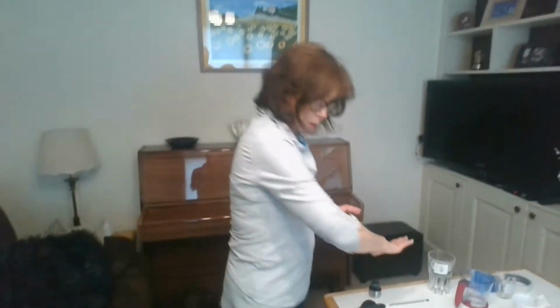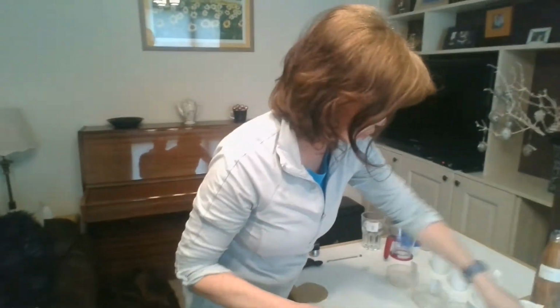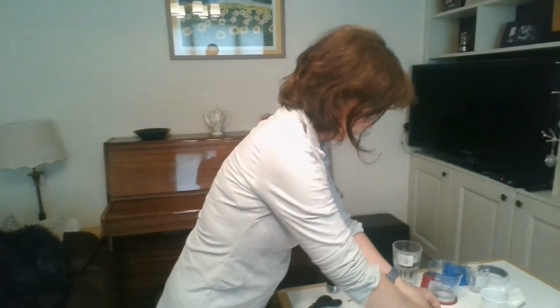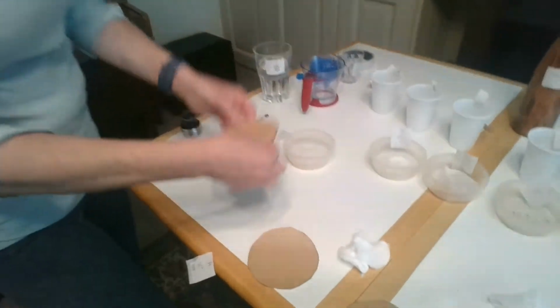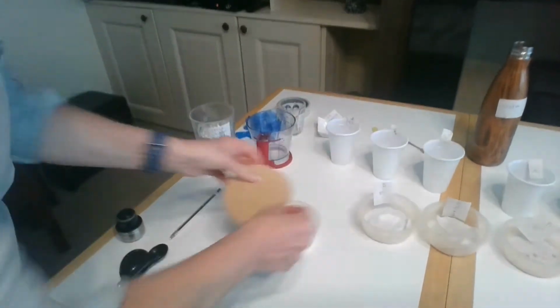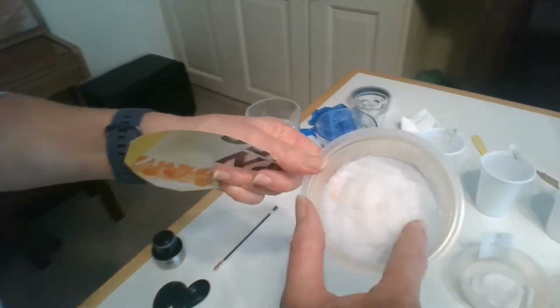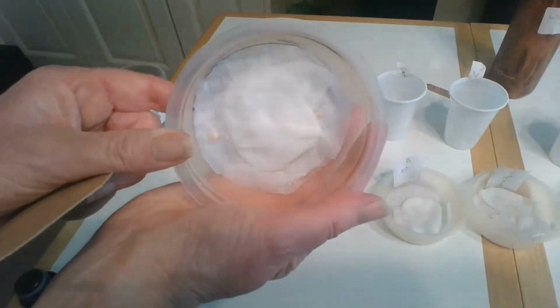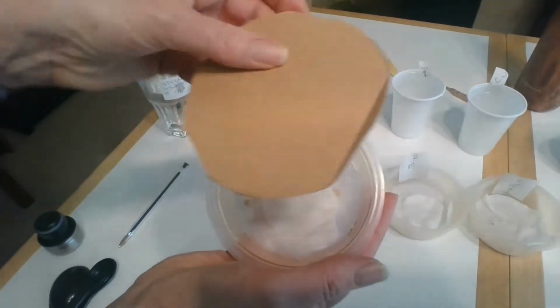Okay, now that we've got all of our Petri dishes with the right concentration of IAA solution, I'm going to keep my label because I'm going to need it. Stick it there, and I'm going to get the lid of my Petri dish. So just go with me on this one. This is the lid of my Petri dish. Now you have to keep an eye. I know my seeds are in a horizontal line like this in the middle, and I have to keep the seeds horizontal. There should be loads of cotton wool in here, keeping everything in place.